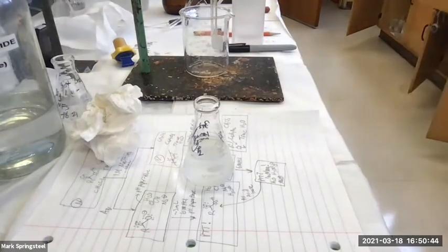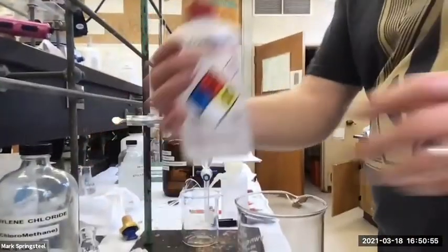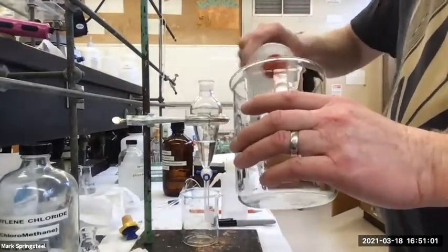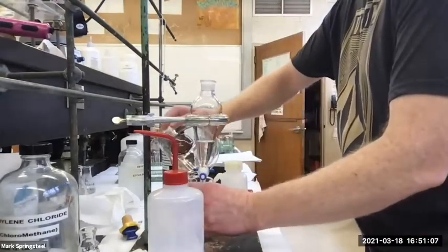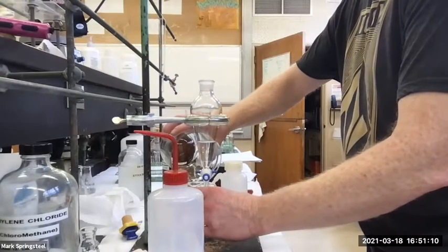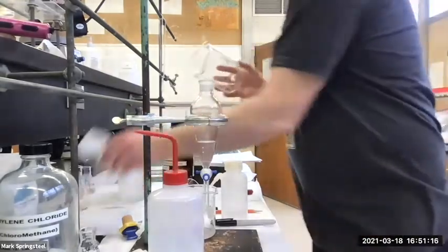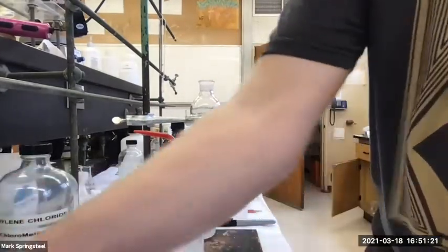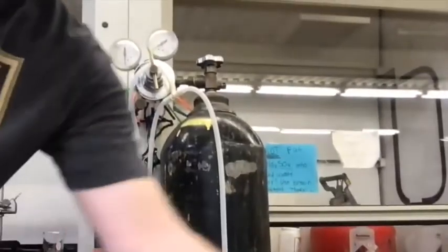Actually, I'll do it in front of you here. I'll grab a little acetone. So I've got my bottle of acetone. And I'll squirt some in there to grab onto the last residual water that's in here. Now the acetone that's in here has a much lower boiling point than water, so it'll evaporate quicker. And now I'll blow that acetone out quickly with some nitrogen gas. I'll show you over here. So once again, here's our nitrogen tank.